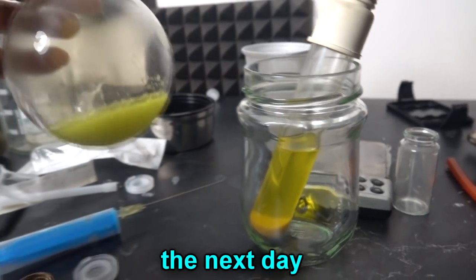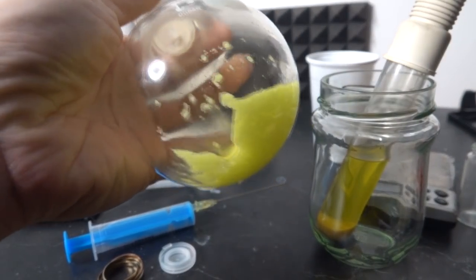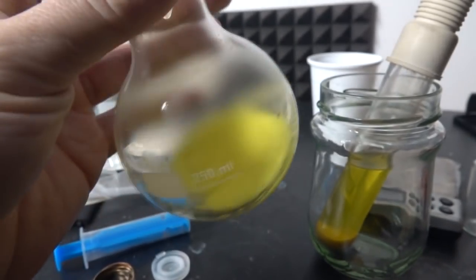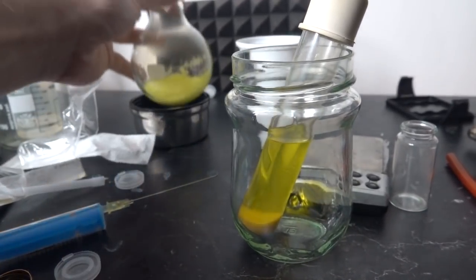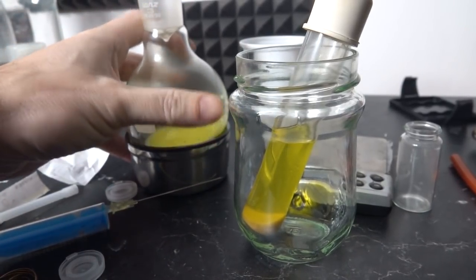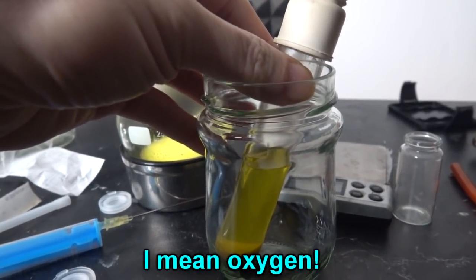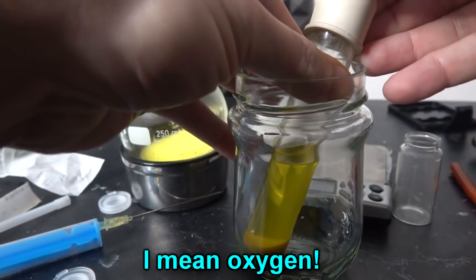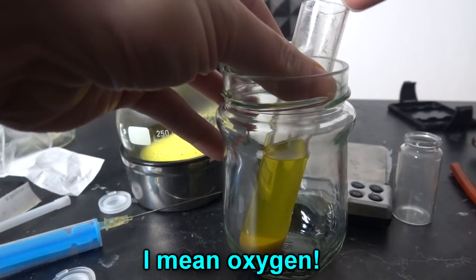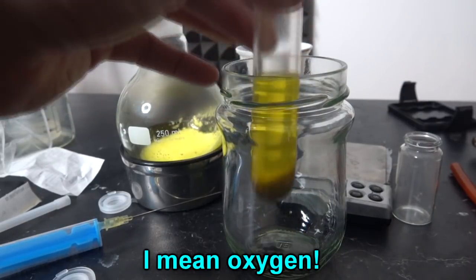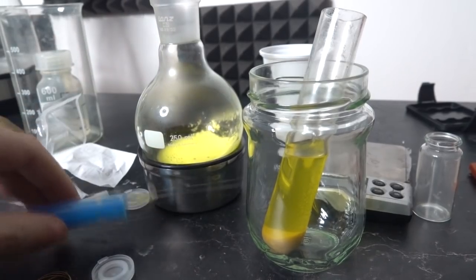But I just can't believe, look what happened with this stuff in the meantime. I'm still not quite sure what the hell happened there. Did it oxidize? Was it a supersaturated solution that crystallized? I'm going to get all of that out and join up my two solutions. I did have this suspicion that this thing is drinking air. This has sucked all of the air out of the top there. So this stuff, whatever it is, reacts with air. I suspect that's what this has done here, and I've got uranium oxide as a result.